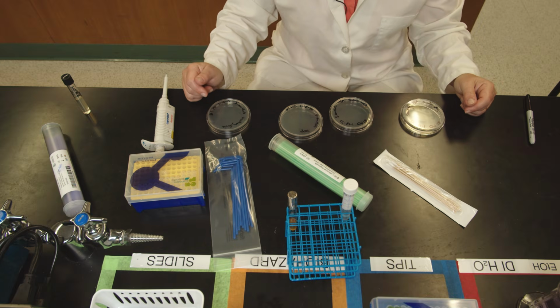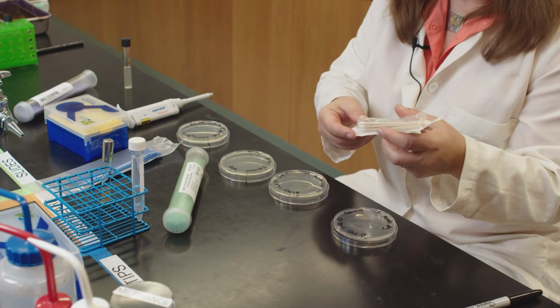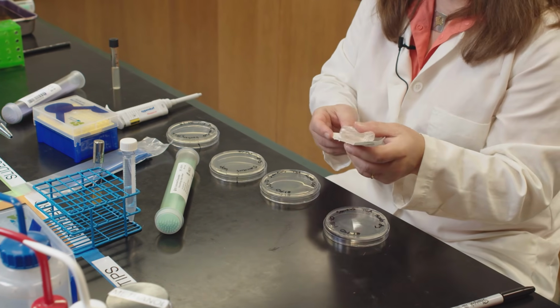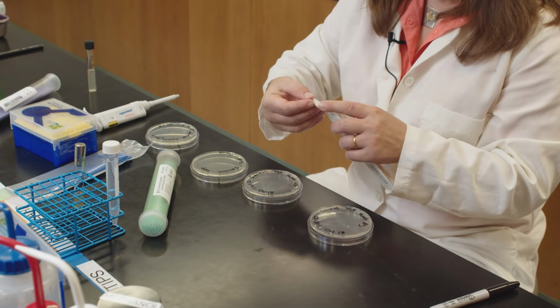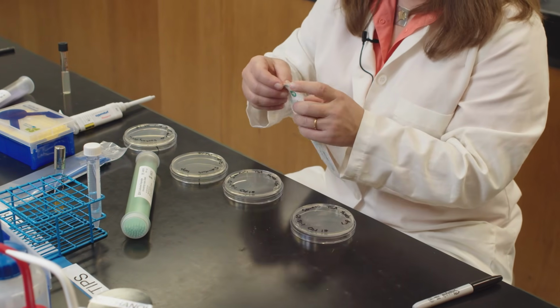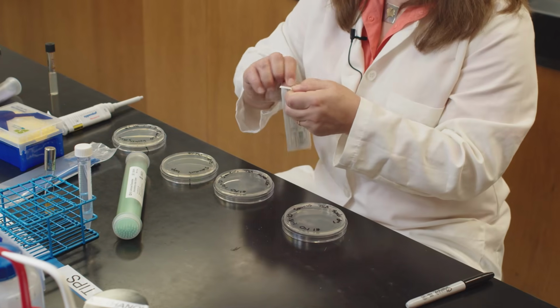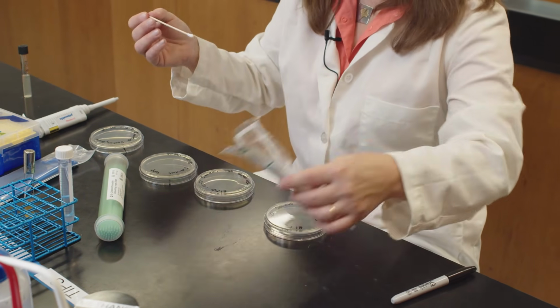So there are different ways of inoculating media. The first one we use is cotton swabs, where you can either swipe wet surfaces or dry surfaces. For the cotton swabs, you always open the end where the cotton swab is not, to keep it sterile. Open it up, take it aseptically, cleanly out of the bag.